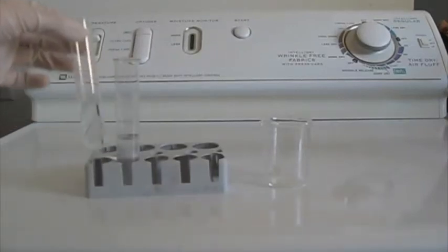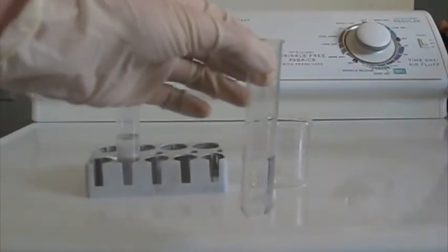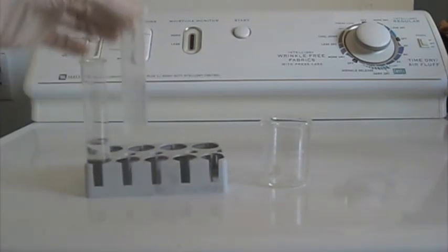Today I will show you the iodine clock reaction and how to perform it. Let's say this is solution A, and this is solution B.